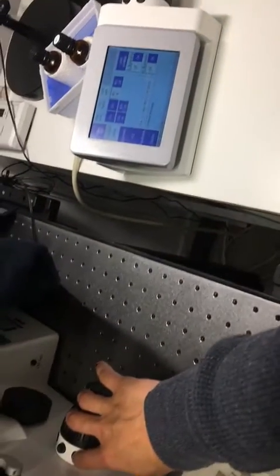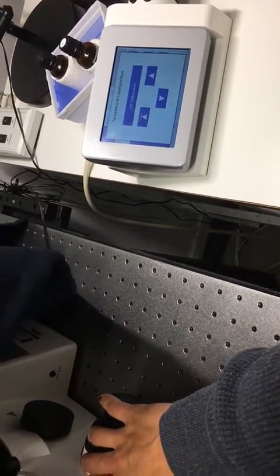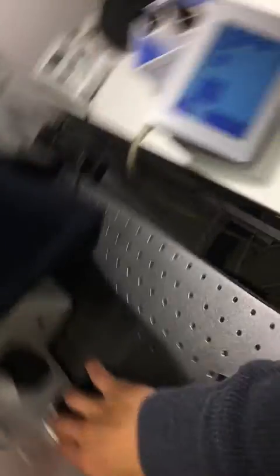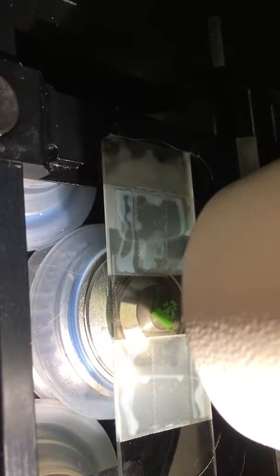When I click on these buttons, information appears on the touch screen, and also the lens goes up and down. This is load position, and this is work.